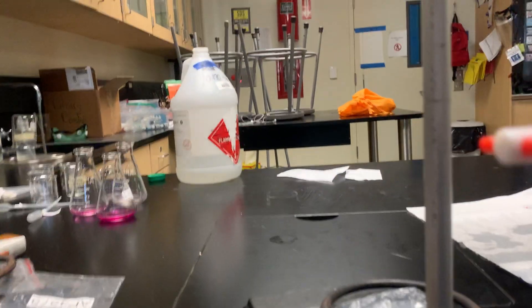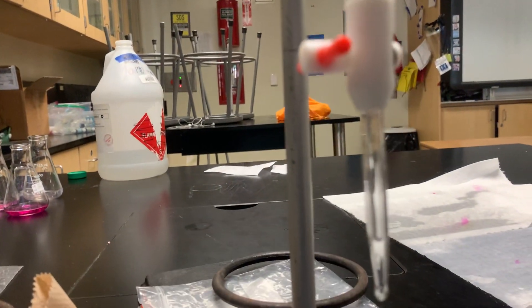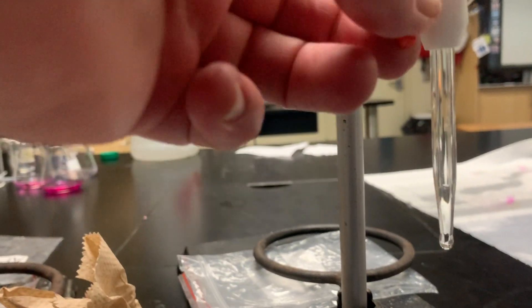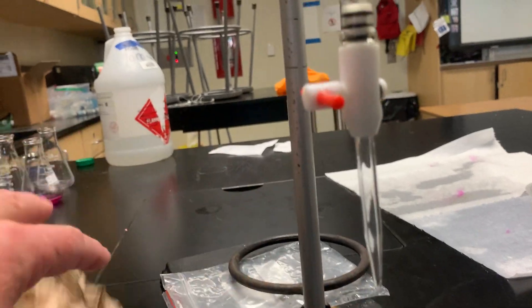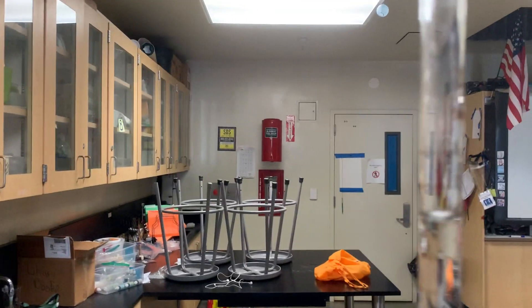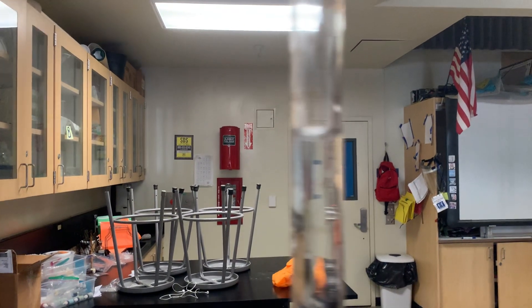That can't be our starting spot because we have some air in our tip. So I'm going to let some of the liquid out — that gets rid of the air. Take that little drop off and now we're ready to start.